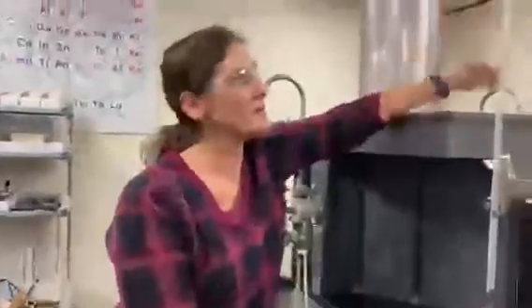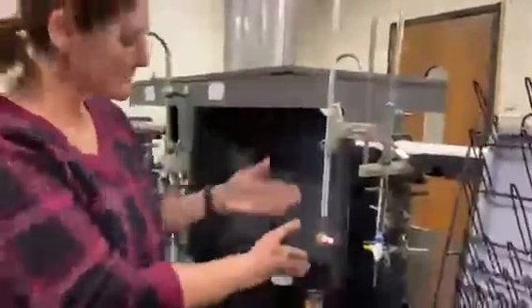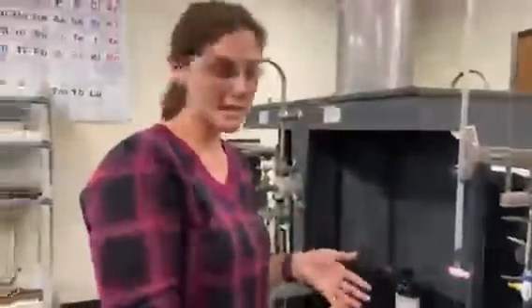I always like to say it looks like you added milk to orange juice, and I don't know, a little grenadine. Okay. And I'm seeing that I added, according to this, around 5.5 mLs. I started all my burettes at 0. Now we would do multiple trials of this and average them together, which you'll get the data.